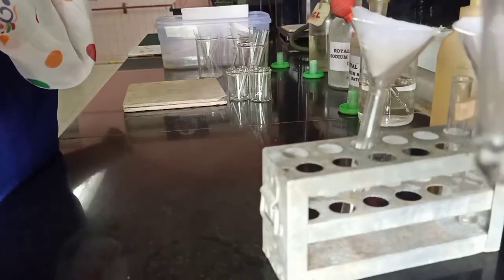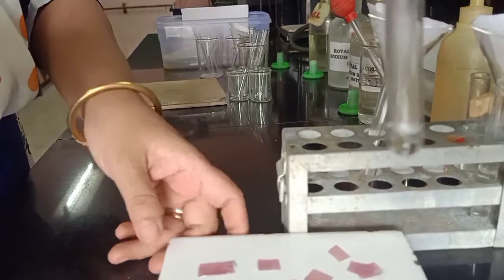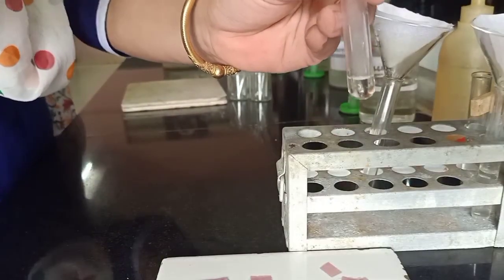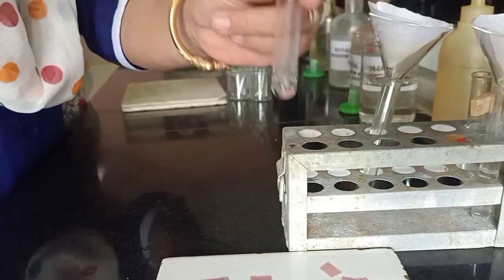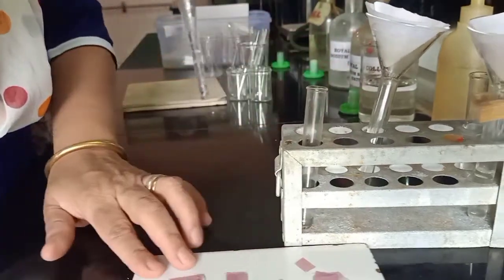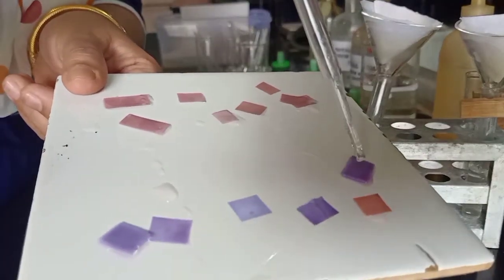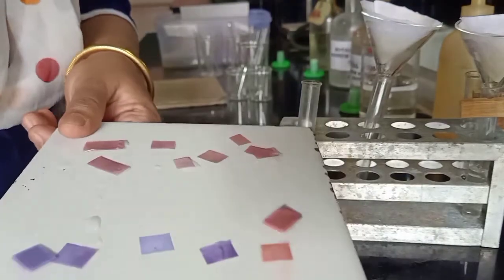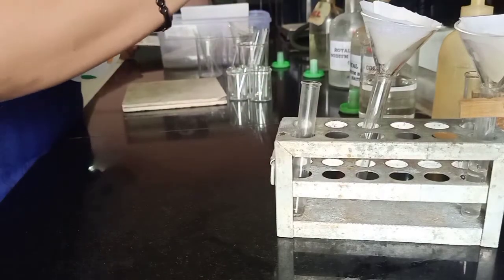Before we say there is no re-precipitation, let us confirm if the medium is acidic. We will check it with litmus — let us see whether we have added sufficient acid to re-precipitate a phenol. We will transfer a few drops of the filtrate onto a litmus paper. As you can see, blue turns red — the medium is acidic enough but still we have not got re-precipitation. This indicates that a phenol would be absent.